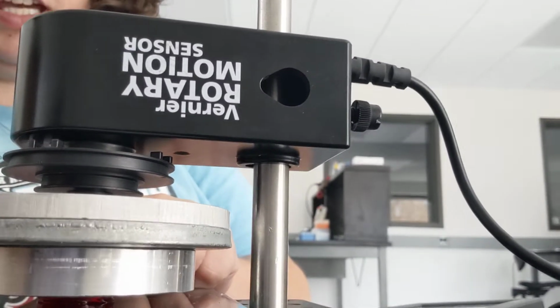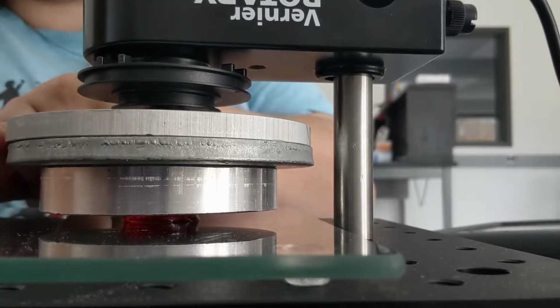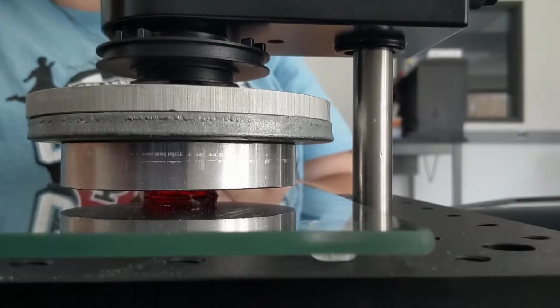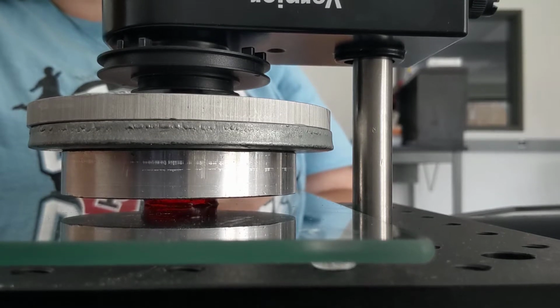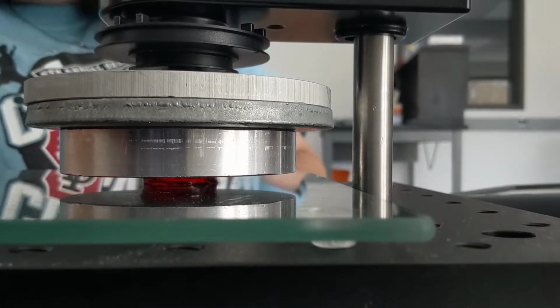We purchased the accessory kit that came with the sensor, and it came with these two discs right here. We've attached a third disc underneath out of a piece of spare aluminum, and that allowed us to have a nice flat surface to sandwich our sample. You can see our food sample right underneath there.